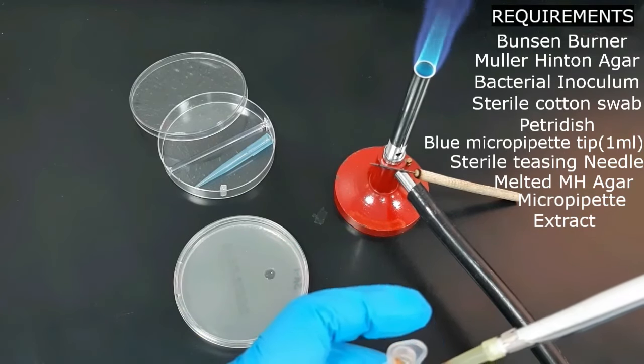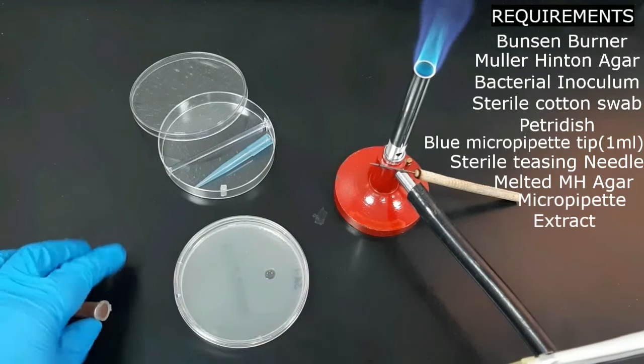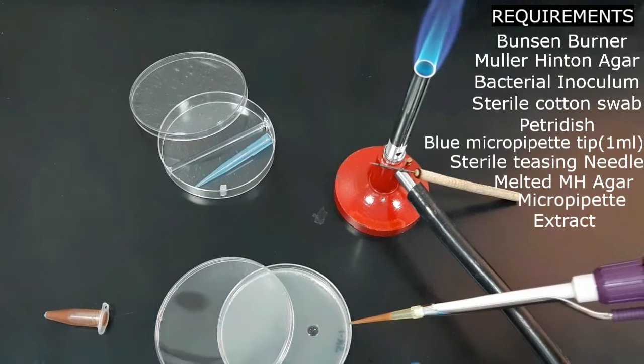Then add the prepared extract to the well. Usually a well can easily hold 100 microliters of the sample extract.